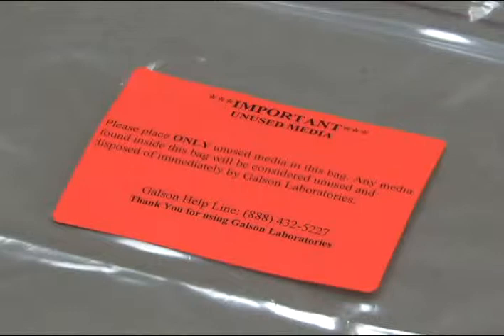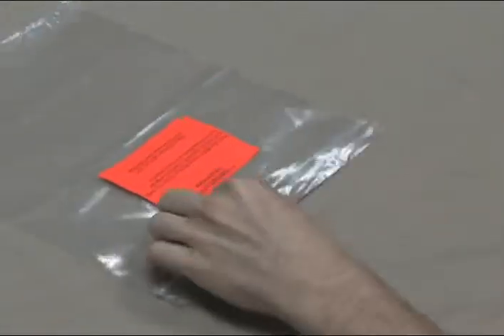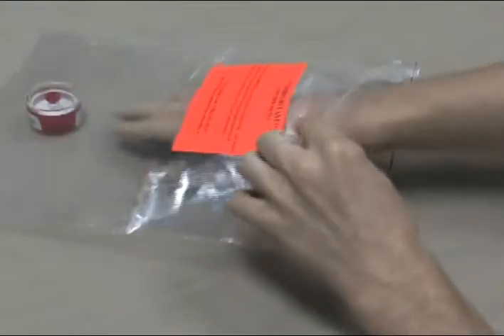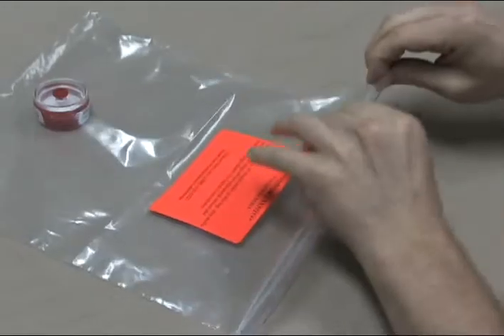Please place any unused media in the Ziploc bag marked with the orange unused media label. This will indicate that these items should not be analyzed and will be properly disposed of by Galson Laboratories.